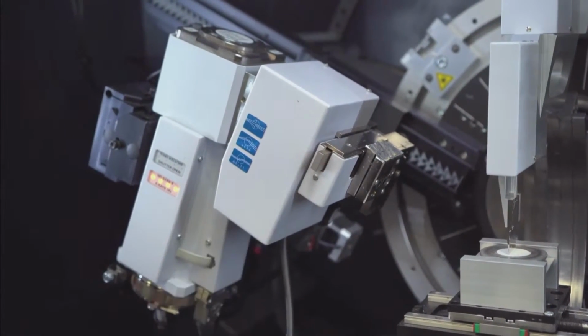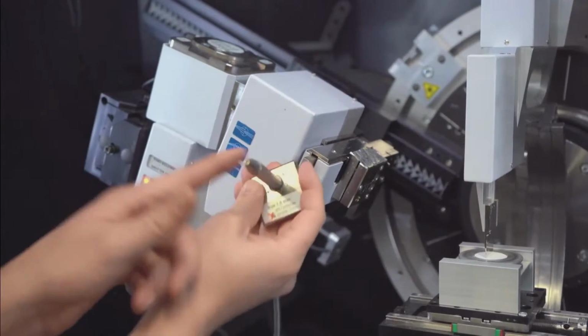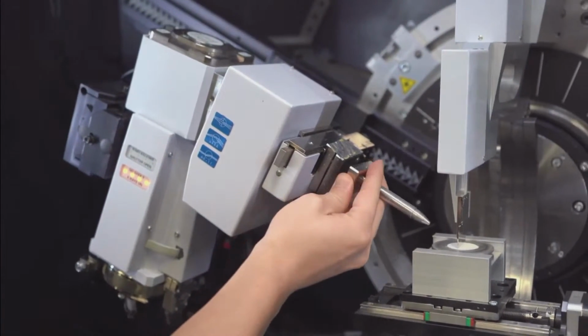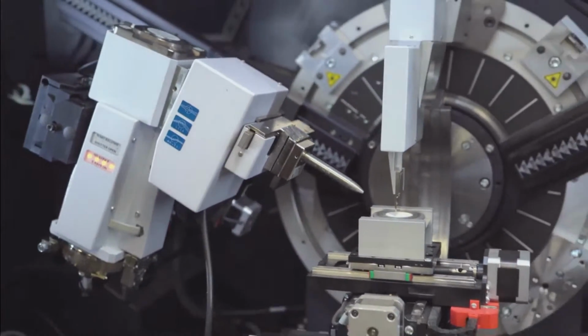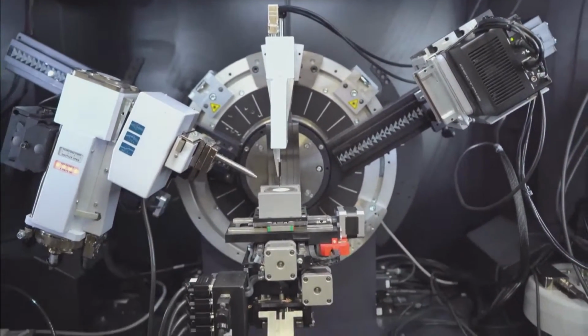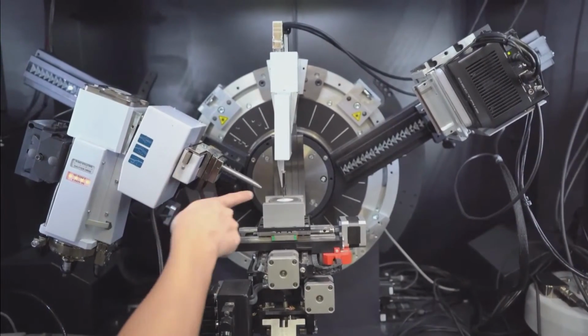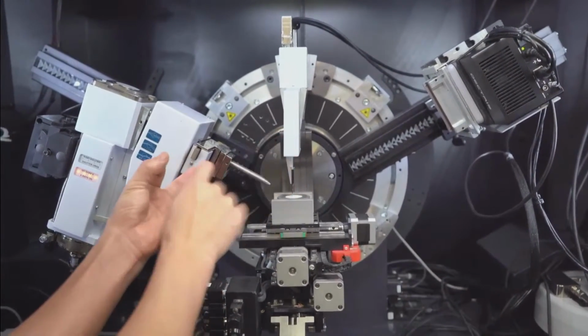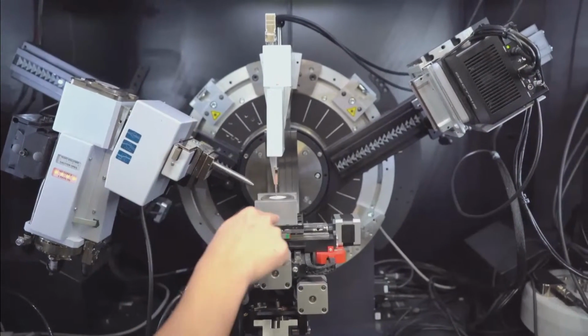I'm going to use one pinhole here, and then a collimator, which is going to give me another pinhole very close to my sample. These are magnetically attached, so it's on. No wrenches, no screwdrivers or anything necessary. The magnets just attach it in at the same position every time. So now I've got this straight parallel beam and two holes that are going to generate a very, very straight point on my sample.